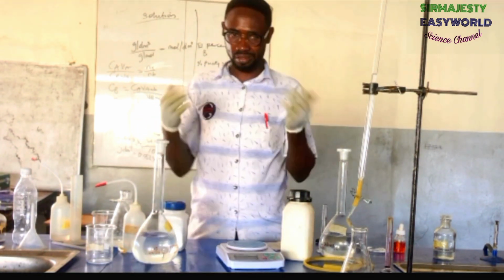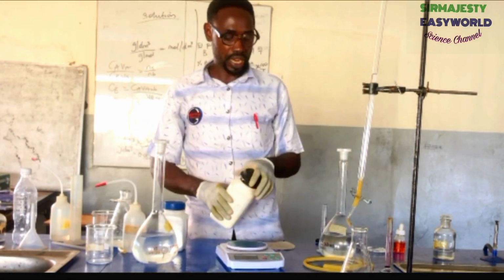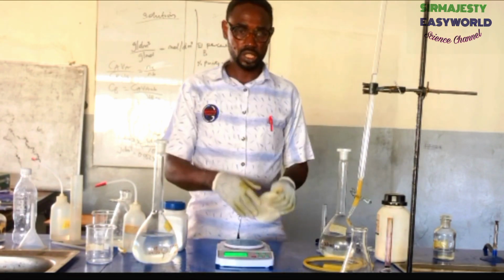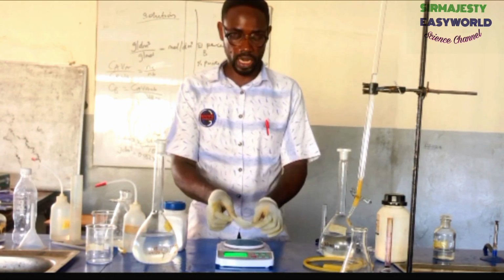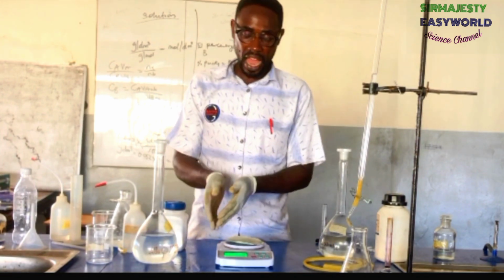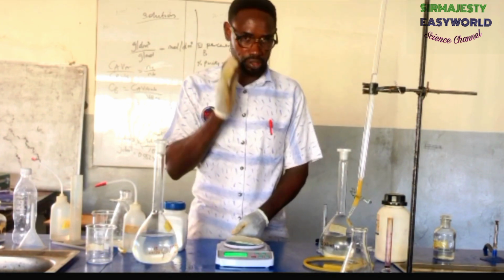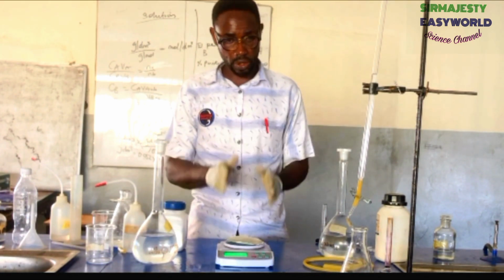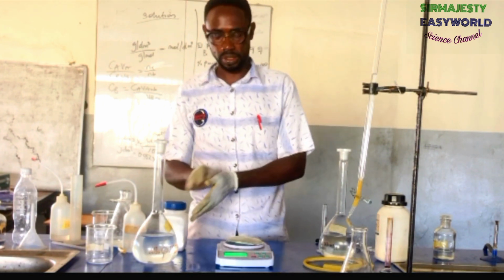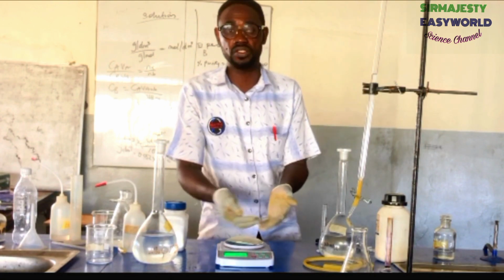Allow it to sit for at least 4 or 5 hours, then you come back and do your titration. See what you will not do. Don't measure both the sodium carbonate and the sodium nitrate collectively at once. Maybe you measure that 5.5 here and you want to add 2.5 to it. Don't do that. What makes this risky or inaccurate is, what if you add more than 2.5 of that impurity? How will you remove it? You might remove carbonate alongside when you are trying to remove it.